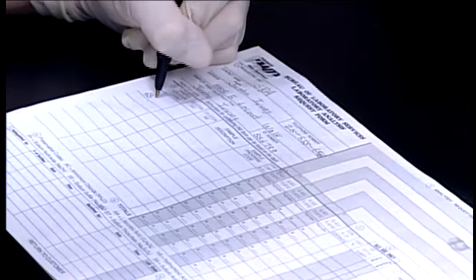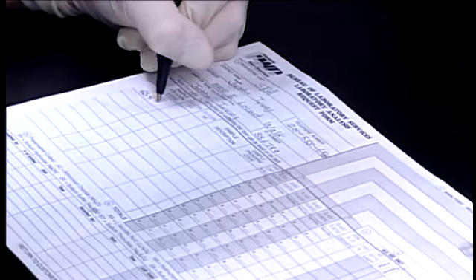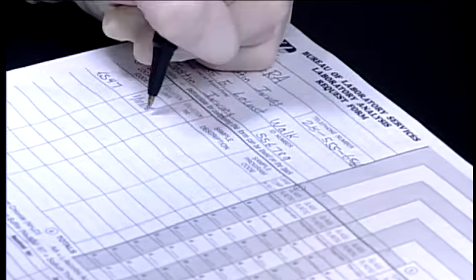The same information should be found on the chain of custody sheet, along with other pertinent information such as sampling site conditions that could affect the integrity of the sample.